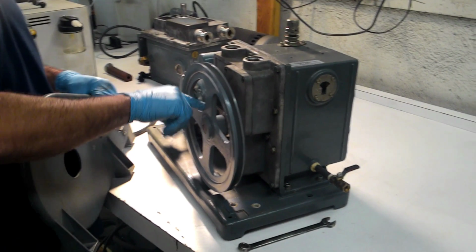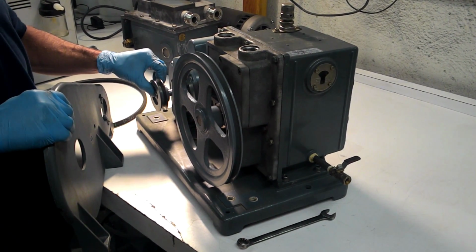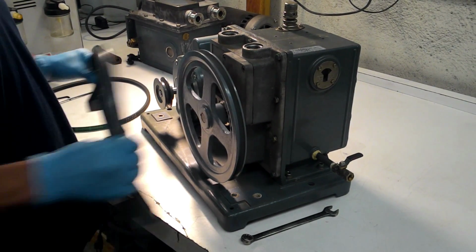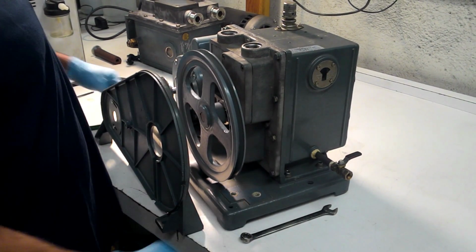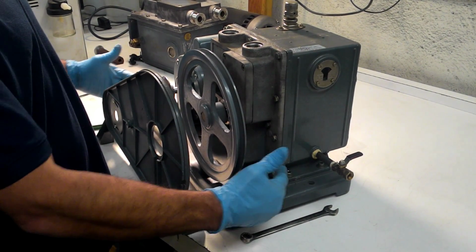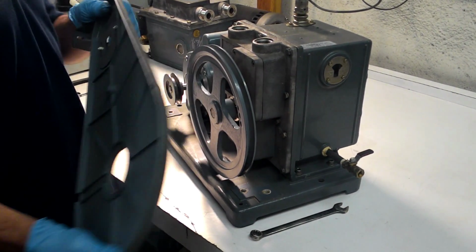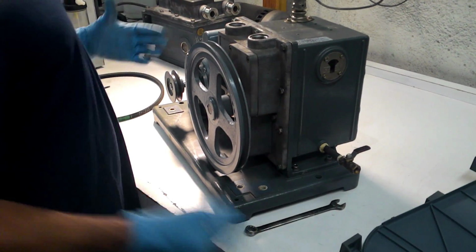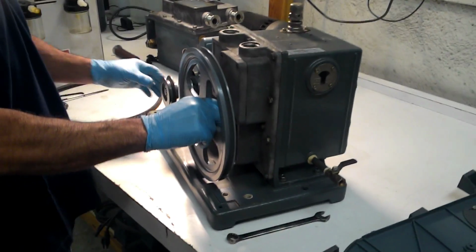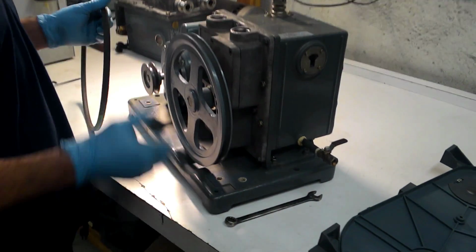So basically there's an Allen screw behind this pulley and an Allen key on the back of this pulley. You pull them both off. This just slides in, gets fastened with 4 bolts here. You tighten them up. There is no adjustment of that because it's already centered. So we took it off today just to show you so that you can have a better view on how to adjust the belt.